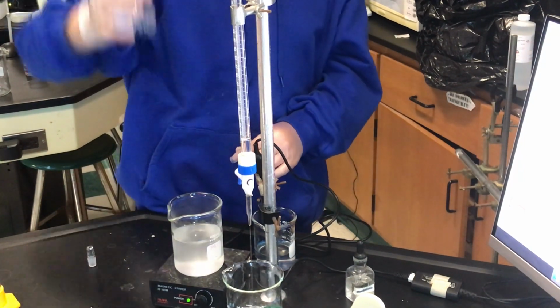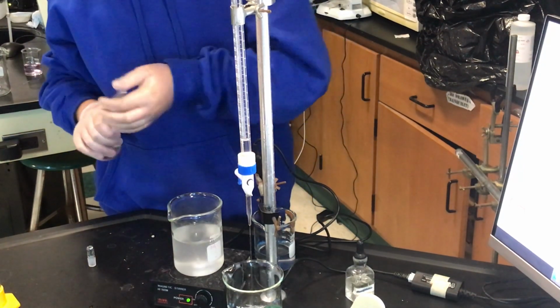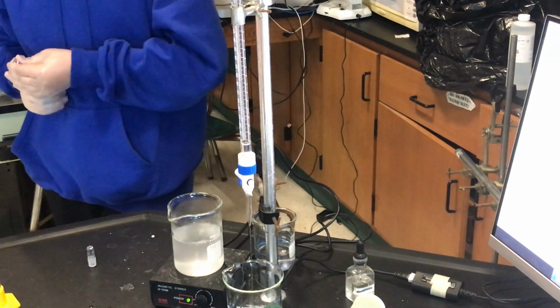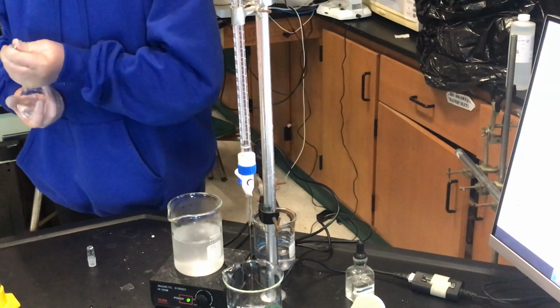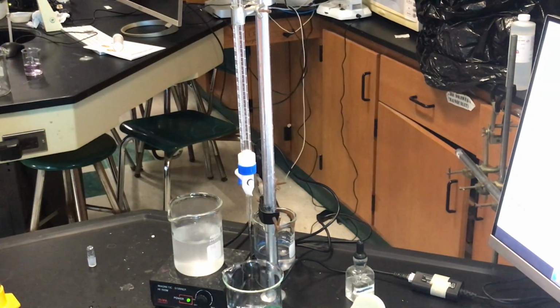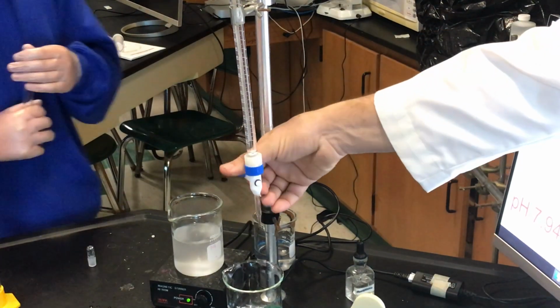All right, good. So we're rinsing out the burette with our titrant, because we had a base in there. If we were to put the acid where the base was, we would be diluting, okay, our H plus. So anytime you're putting in a new titrant, you should rinse it out. Okay, now let's add everything there. Add the entire amount of HCl there. It won't be to 50, so put the entire amount, let's close it off. Let's add the rest of it.